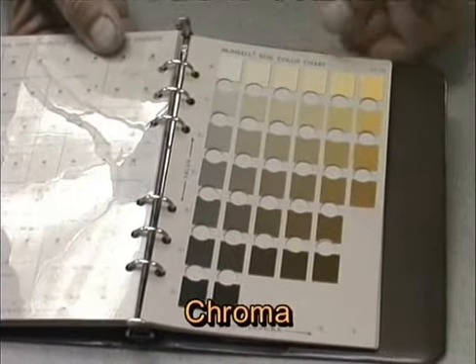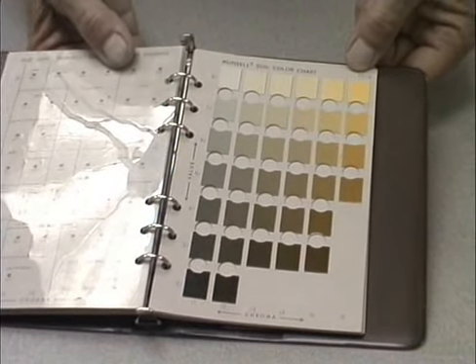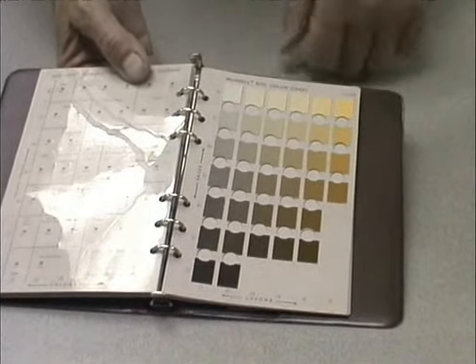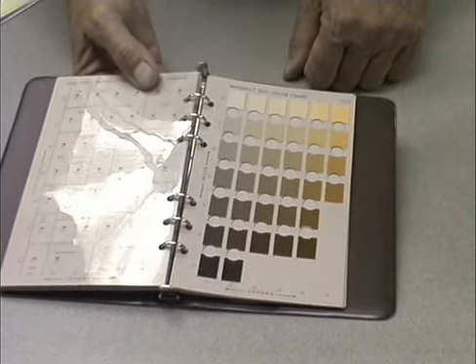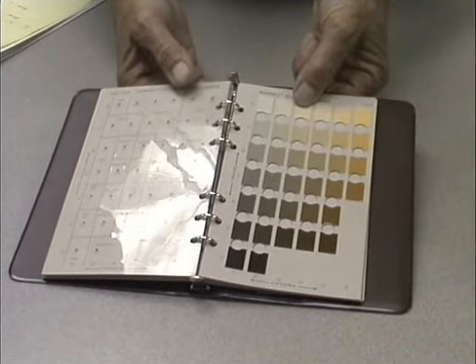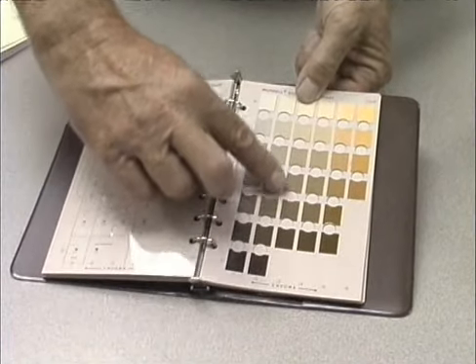So everything on this particular page would have a hue of 10 YR. Everything in this entire row would have a value of 8. And then let's say if we had a soil that was this particular color that I have my thumb on right here, we would read up from the bottom of the chart where it shows a chroma of 3.